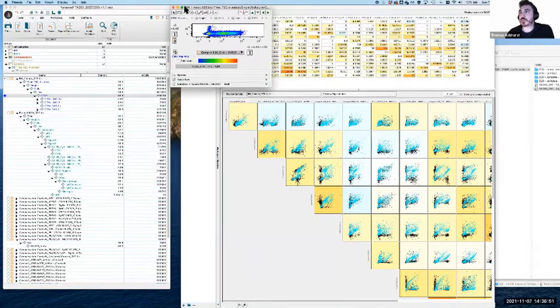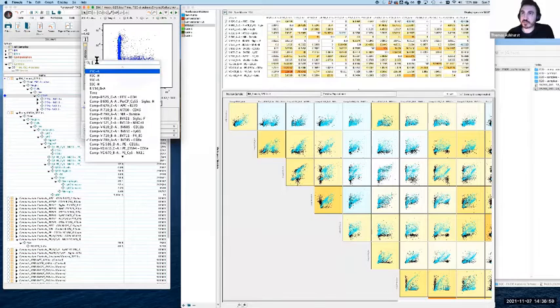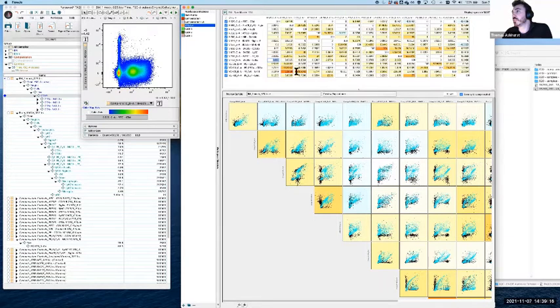And just to orient the way this looks, you can sort of think of it like the row is on the left, so that's the y-axis in this case, and the column is the x. So let's have a look at this. This is BV785, so we'll go and find that one here. So this row, BV785 and spilling into the V610 detector, which is here. So this is the compensation value for BV785 being compensated out of the BV605 detector. That's what we're looking at here.